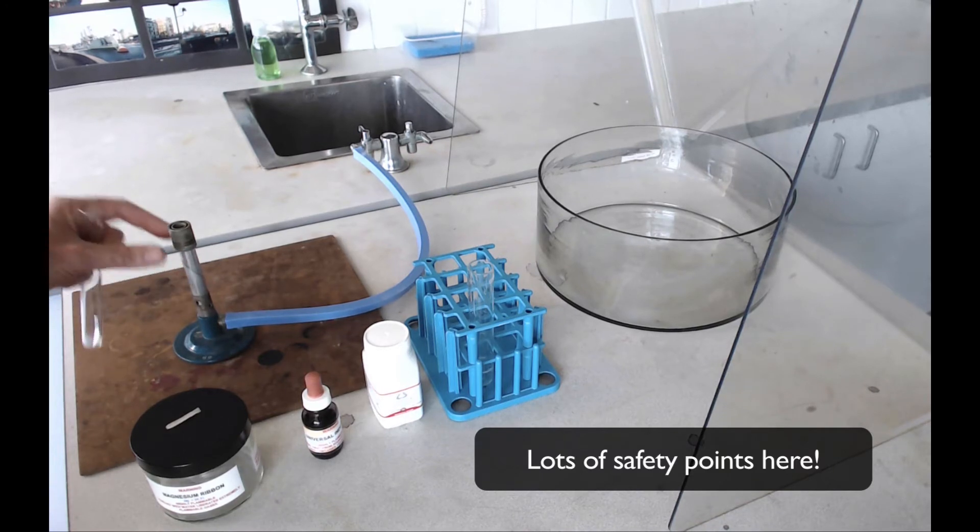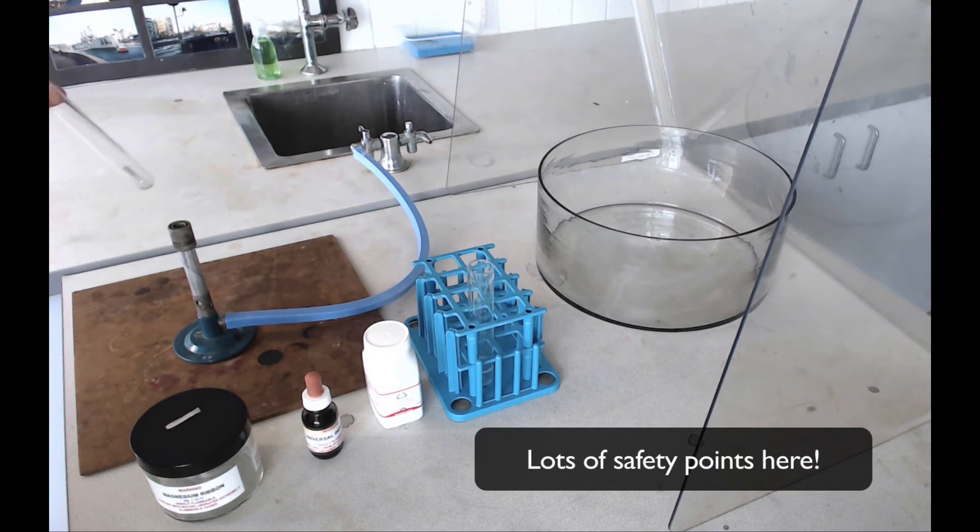We want to hold the tube at an angle so that we don't burn our fingers over the flame. We're going to want to just hold it until we can feel the tube starts to vibrate a little bit. That's giving you a sign that the water's going to start boiling soon.